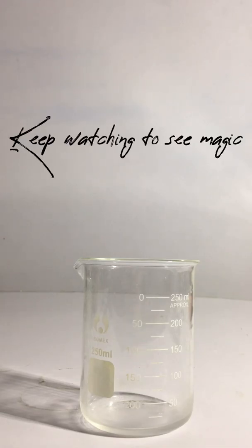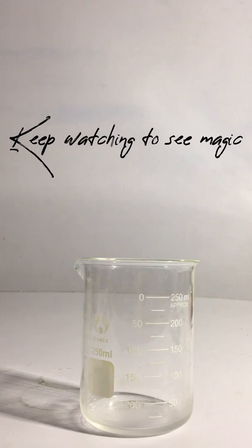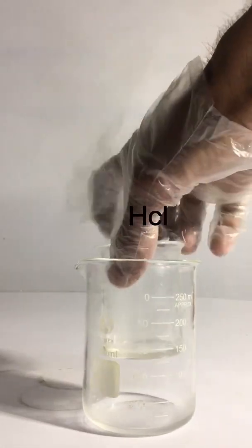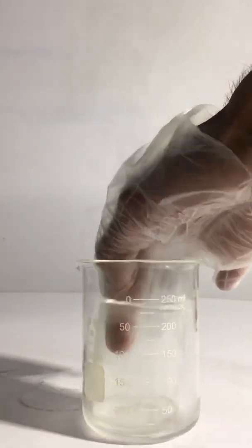In one beaker you have to take ammonia and in the second beaker you have to take HCl. You can see it. Now what you have to do is place the HCl beaker into the ammonia beaker.